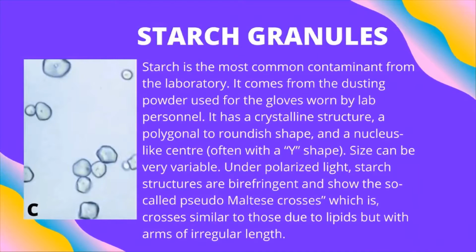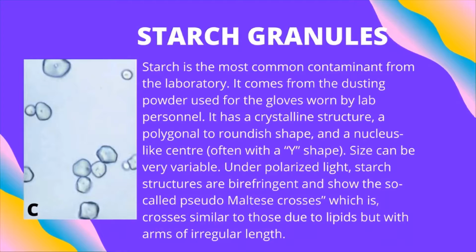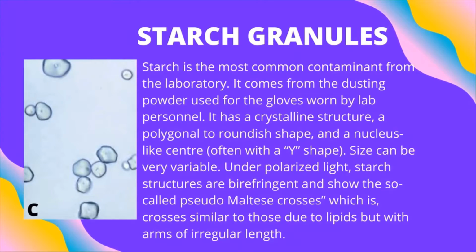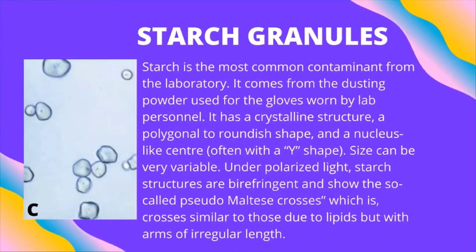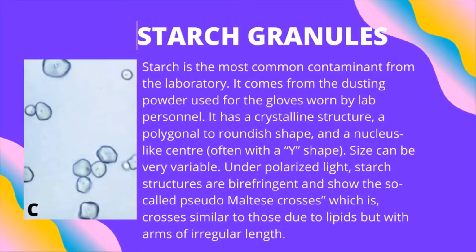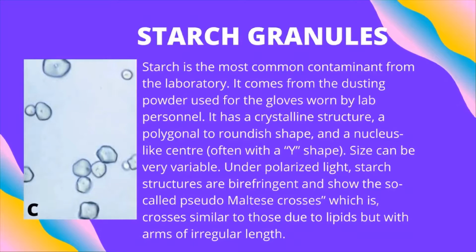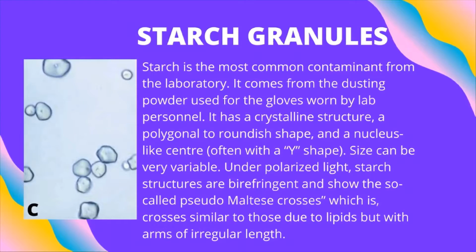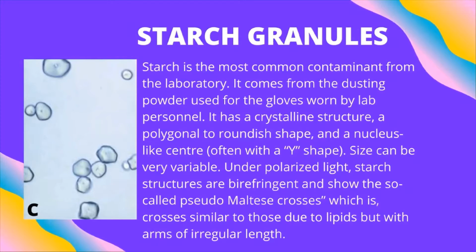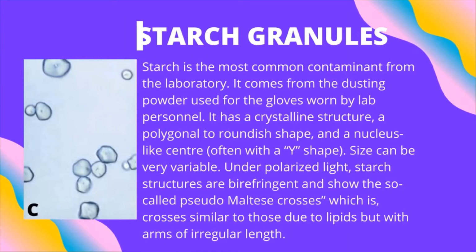Starch is the most common contaminant from the laboratory. It comes from the dusting powder used for the gloves worn by the lab personnel. It has a crystalline structure, a polygonal to roundish shape, and a nucleus-like center, often with a Y shape. Size can be very variable. Under polarized light, starch structures are birefringent and show the so-called pseudo-Maltese crosses, which are crosses similar to those due to lipids, but with arms of irregular length.